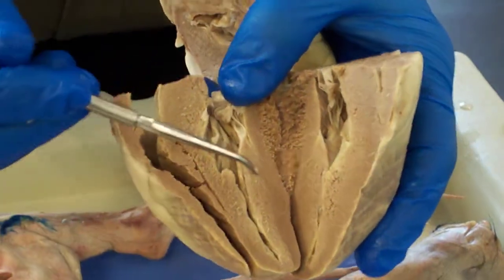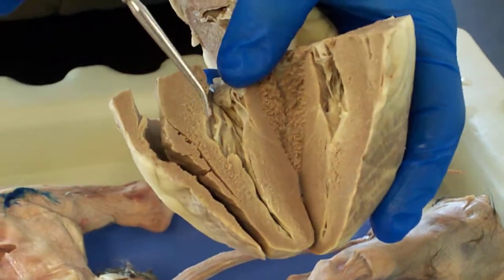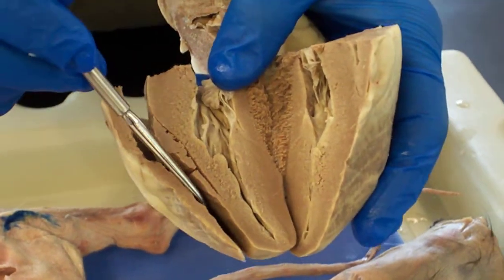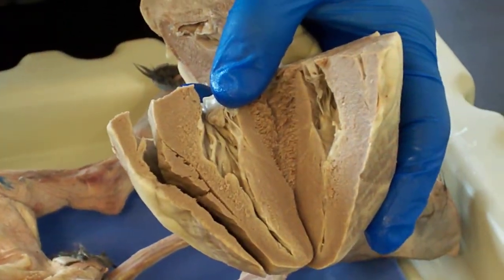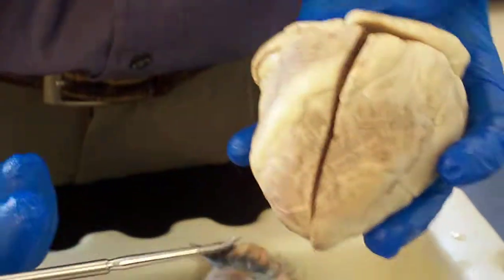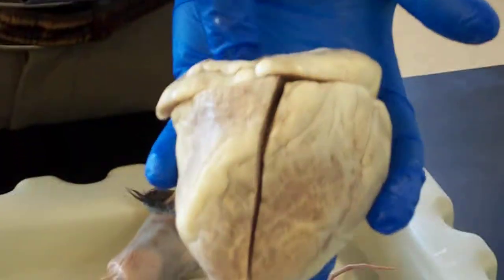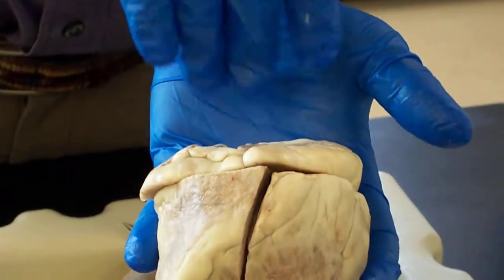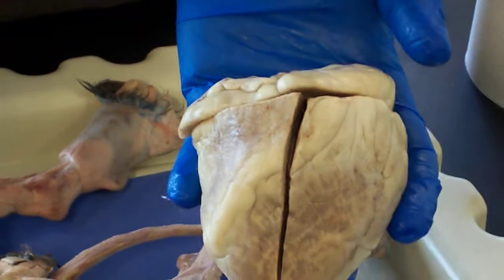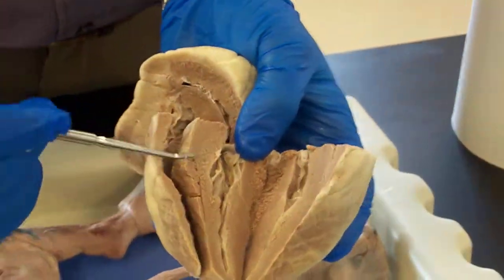Here's the wall of the right ventricle, and here's the thicker wall of the left ventricle. We have this interventricular septum that separates the left ventricle and the right ventricle. If you look at the outside of the heart, the tip down here is actually the apex of the heart, and the base of the heart is at this end where the aorta and the pulmonary trunk are.